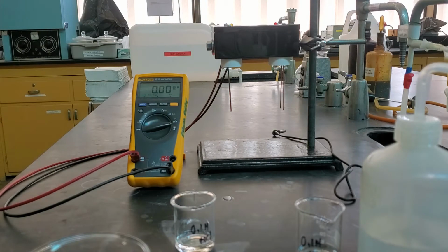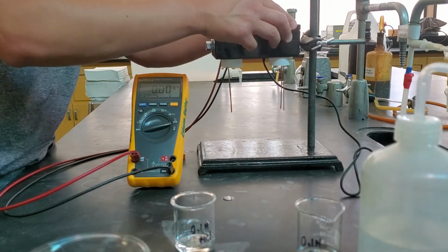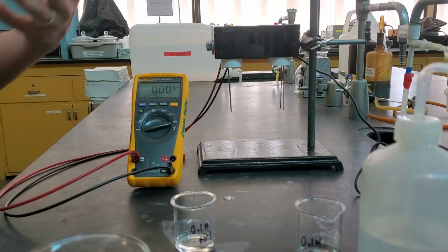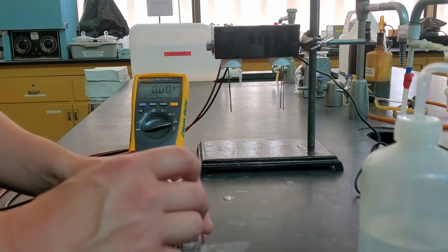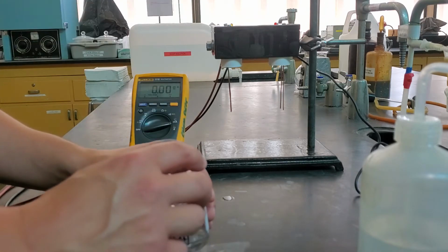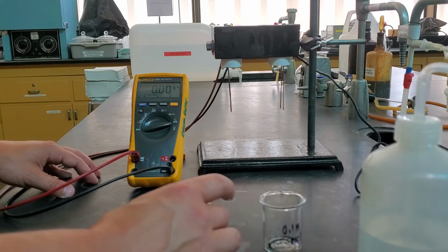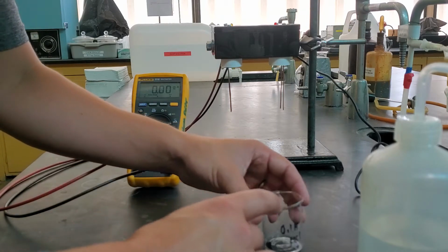Now they say it's measuring them in parallel because we actually have 2 sets of those conductivity measurements, and so when we're running the loop through, we have 2 separate loops next to each other. That's what it means to be run in parallel. In series, it means that one end of this has to go through the other end of that, right? It's more of an engineering term or a physics term, and you get into that when you talk about electronic systems. I've mixed them together now.